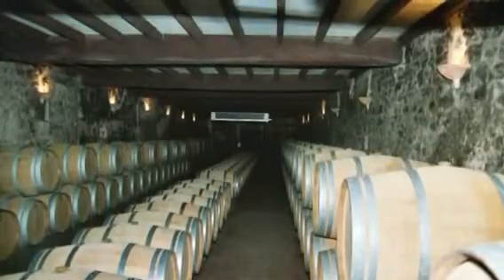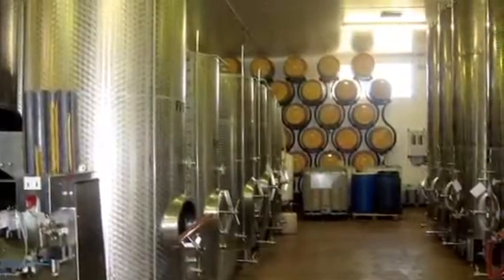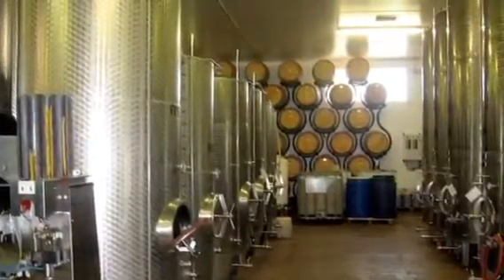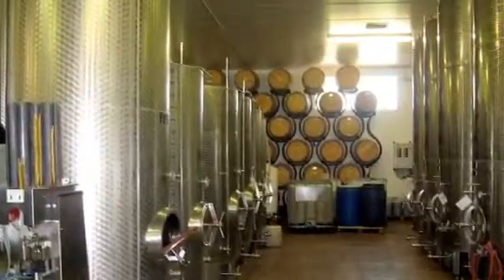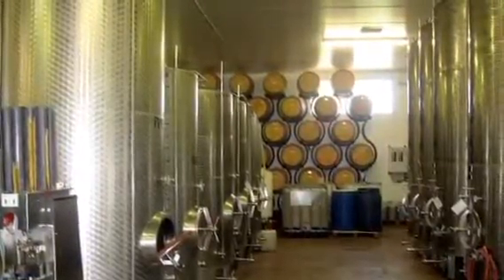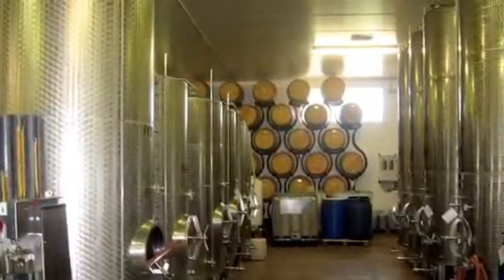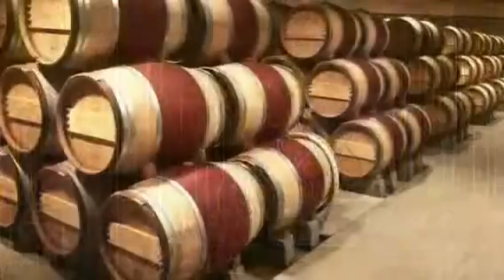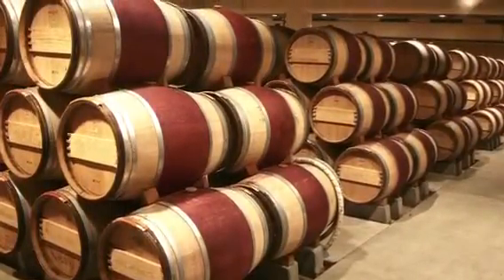If the level is below 10 parts per million in a white wine, it is in danger of going bad. It is very important for winemakers to know the right amount of SO2 they need in their wine. Sulfur dioxide plays a very large part in determining the longevity and the taste of the wine. Too little sulfur dioxide can lead to a wine going bad quickly, while too much sulfur dioxide can lead to a foul taste in the wine.